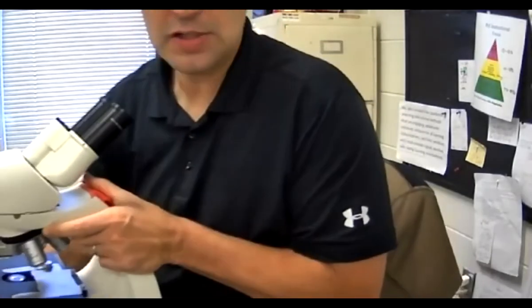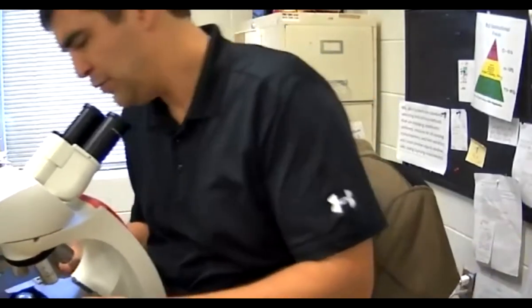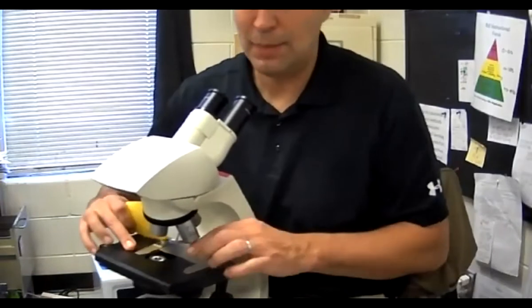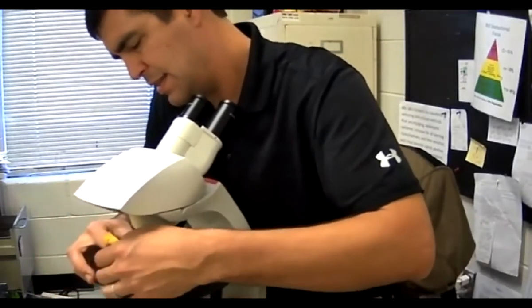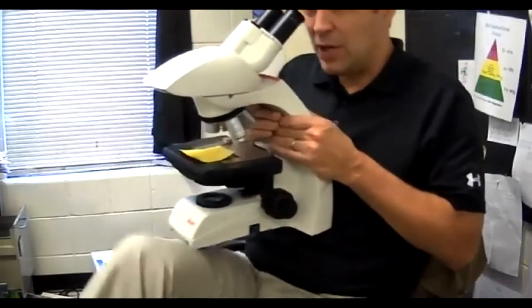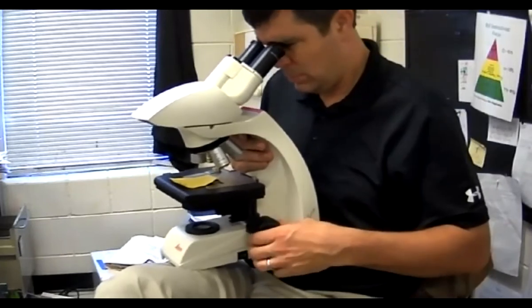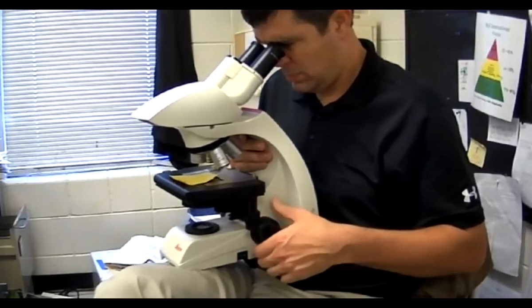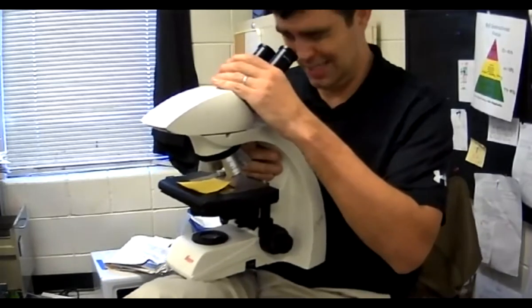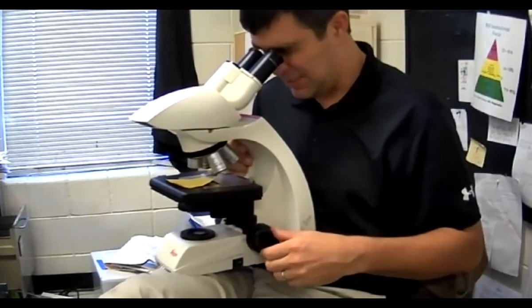The next thing: if we're looking at a microscope slide, you clip it in by pulling back this right here and then clipping in the slide. I use my coarse adjustment to zoom it into focus — it actually works even without power right now because there's still light in here. I use my fine adjustment to get it in focus and clear.